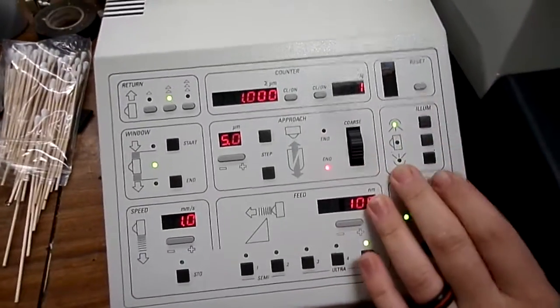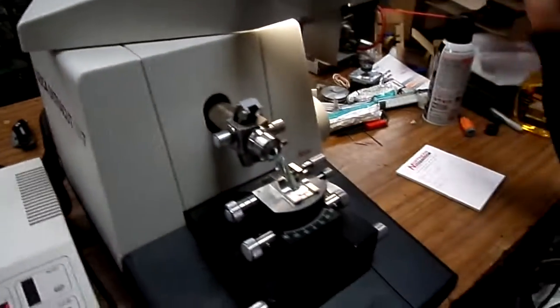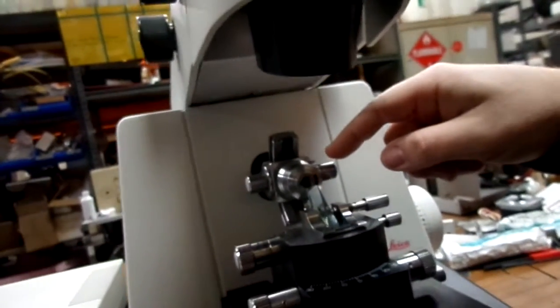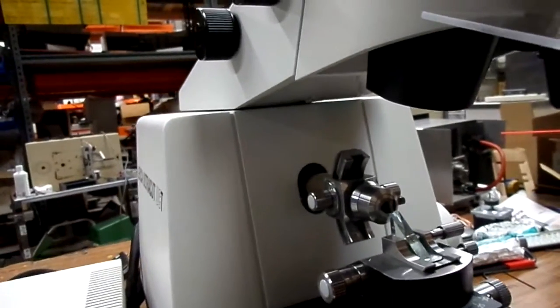You have different lights on the illumination. This one lights the top light. Then you have the bottom light from underneath. Then if you have the optional light in the back of the specimen, it would be the middle button there, but we don't have that on this microtome.